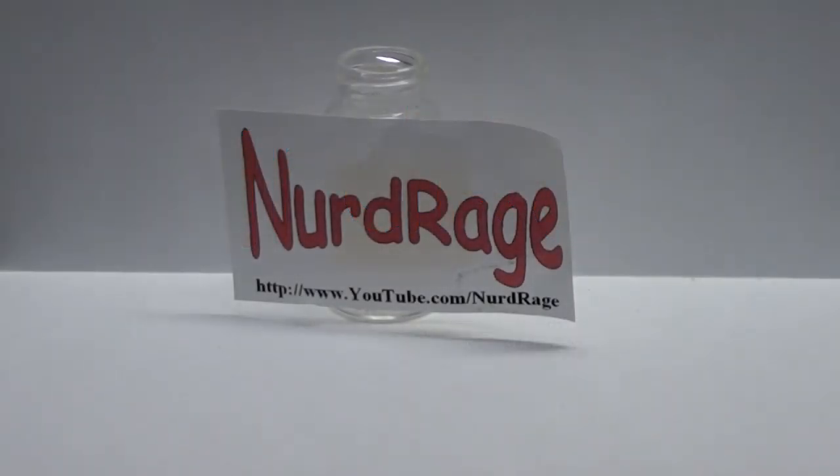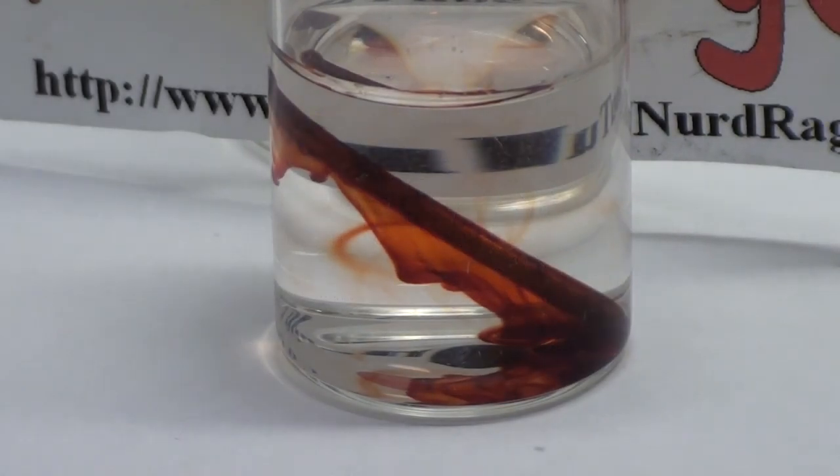Greetings fellow nerds. In this video we're going to make iron nails appear to bleed. The experiment is very simple.